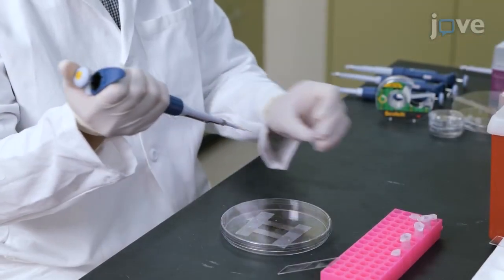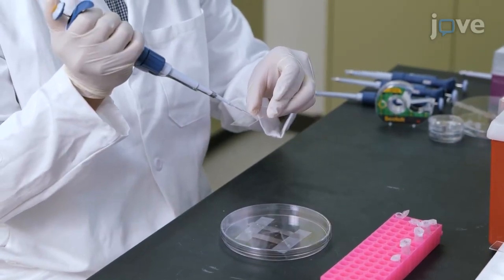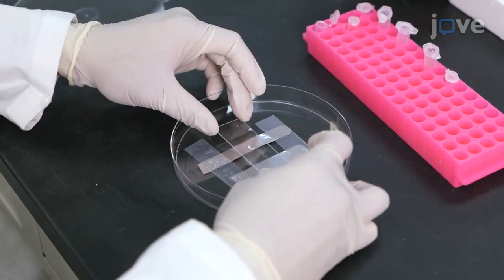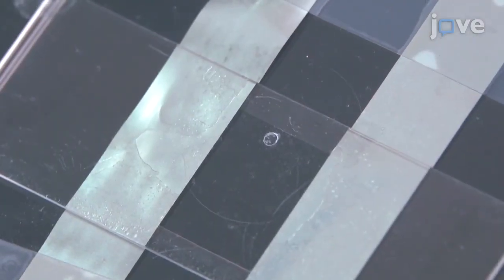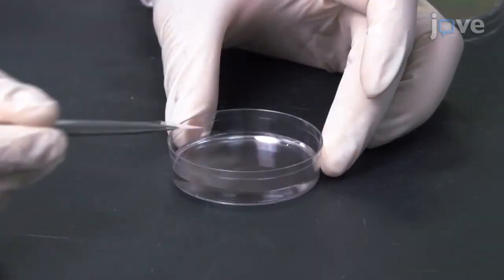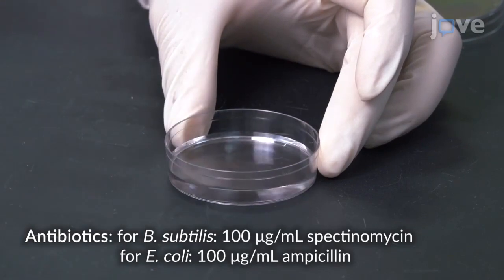After adding the desired volume of the precursor solution on a non-reactive perfluoroalkylated glass slide, place the slide on the base cover slip and allow the hydrogel formation to complete at room temperature for 25 minutes. Once the gelation is complete, gently remove the perfluoroalkylated glass slide. Place the substrate in a 60 by 15 mm petri dish containing ATGN media supplemented with antibiotic.